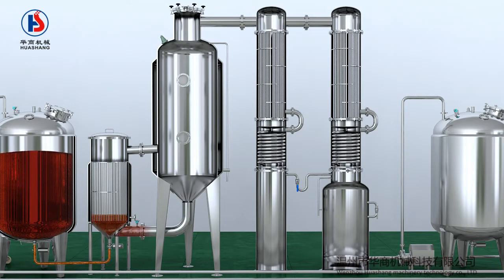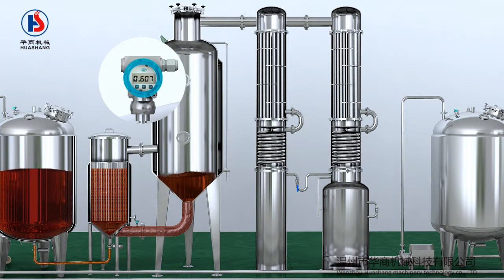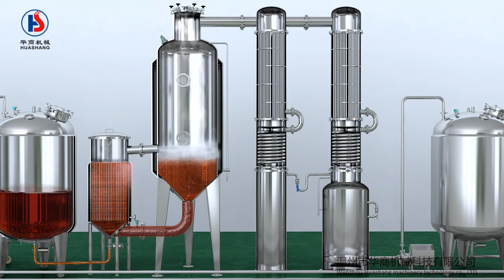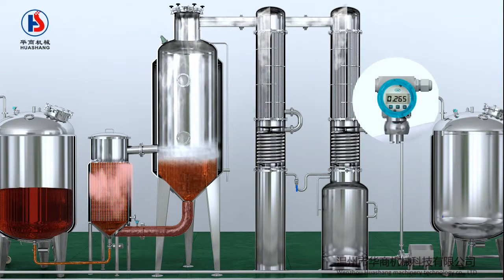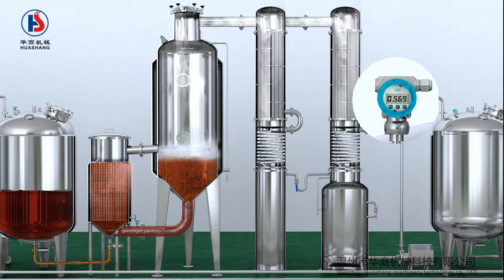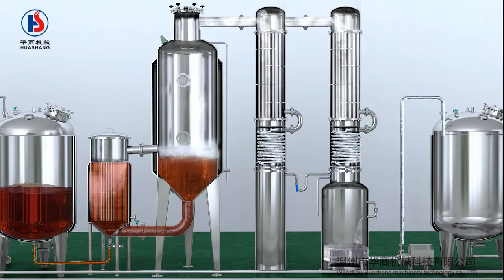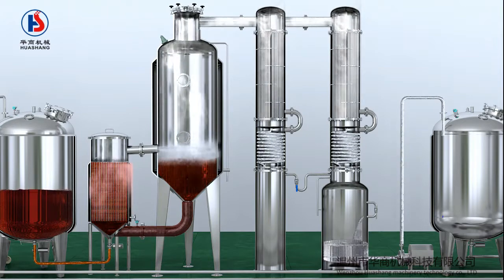Then vacuum the liquid to the alcohol concentrator. The liquid will increase in the concentrator. When the liquid level reaches the set level, open the heating valve. The liquid flows slowly in the heater, and the produced steam is ejected by the curved guide slot, which can greatly increase the heating surface, thereby increasing the evaporation rate. The steam condenses through the condenser and slowly returns to the liquid tank. This tank has an automatic drainage system and will send a signal to the pump when the liquid level exceeds the preset level. The pump will open automatically and transfer the liquid to the alcohol storage tank. Meanwhile, the concentration of the liquid in the alcohol concentration tank slowly thickens, and the concentration rate can be accurately measured through the automatic concentration meter.